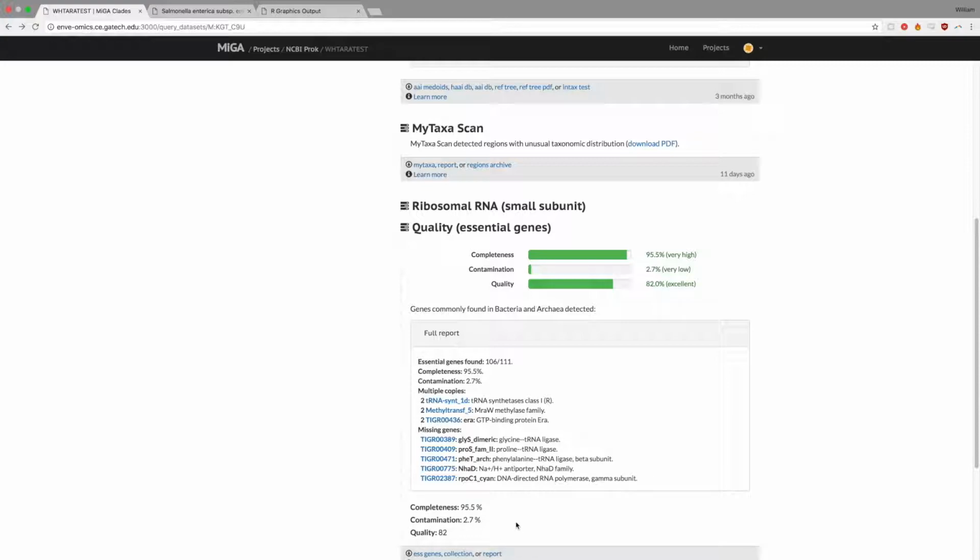This frequency of duplicated genes can also be referred to as chimerism, as it usually, but not necessarily always, is indicative of a chimeric combination between the sequence of the main genome and other highly similar but distinct sequences from other organisms. Chimerism can arise during binning or can reflect actual DNA contamination depending on the source.